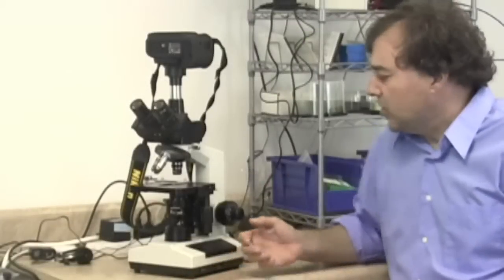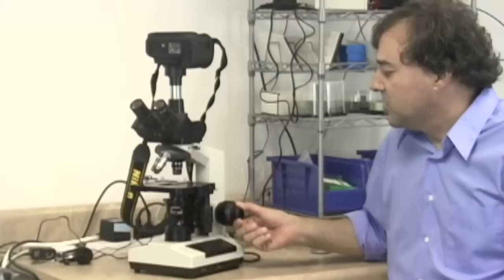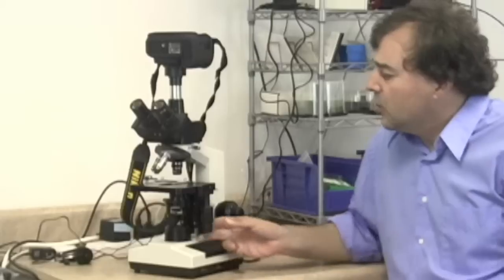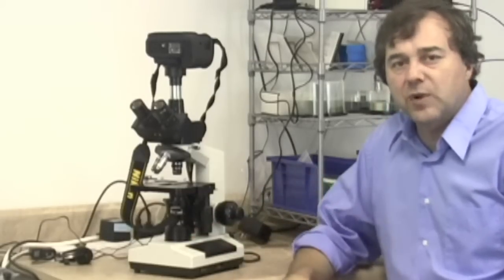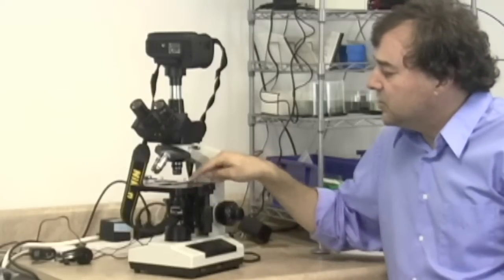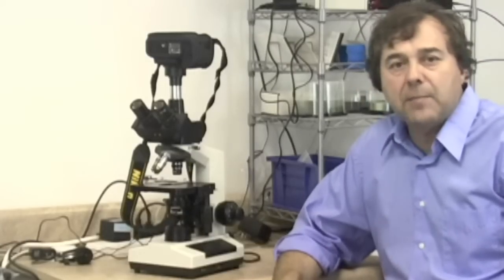In this segment then, we're going to use the coarse focus knob. We're going to use that, of course, with the lowest power objective only. We're going to use the fine focus knob for both the lowest power objective and other objectives as well. We're going to use the XY translation stage mechanism to move our specimen around and search for objects of interest. And we're also going to use these two scales on the X and the Y, on the abscissa and the ordinate, which we can use to then map areas of interest on our slide.